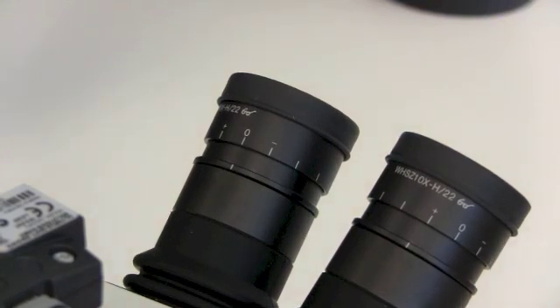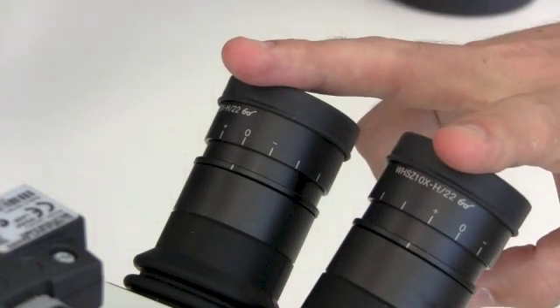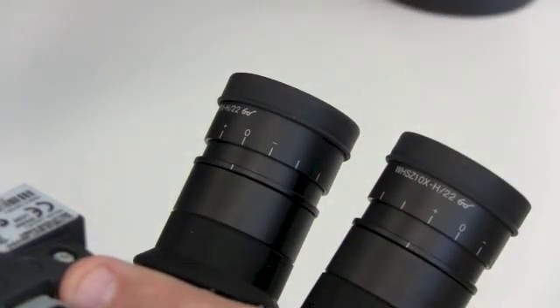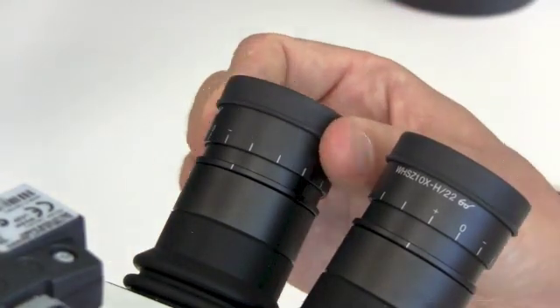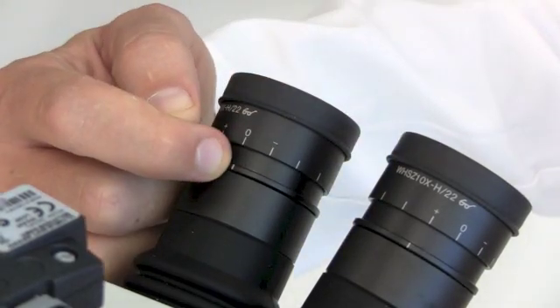When you're using the microscope, it's important to first adjust the eyepieces, because your eyes are probably different to the last person that used them. They'll have a different focal length. Both of these eyepieces are individually focusable, but we've also got the video camera on there. The video camera has been put on in such a way that the right eyepiece must be adjusted so the zero is right in the middle with that line.